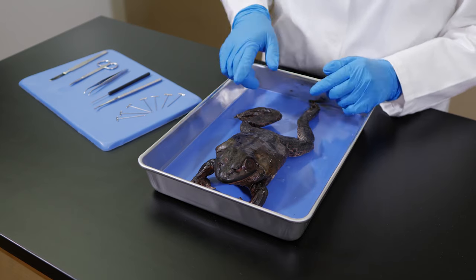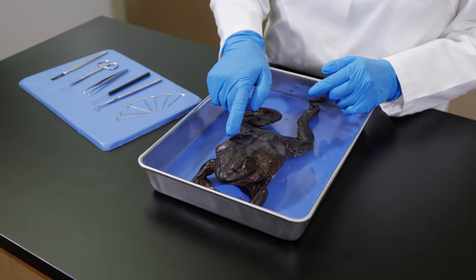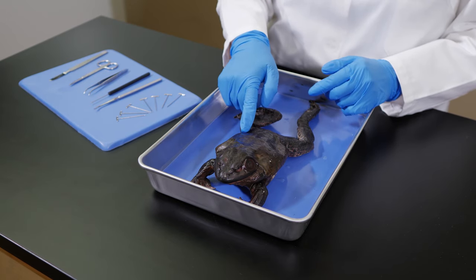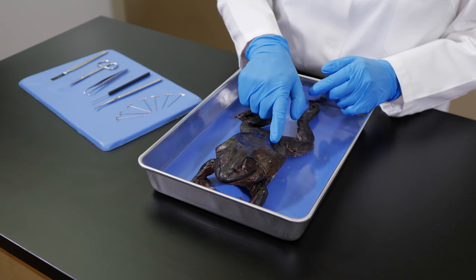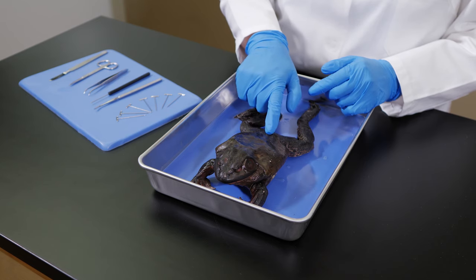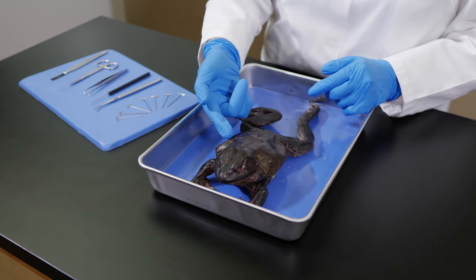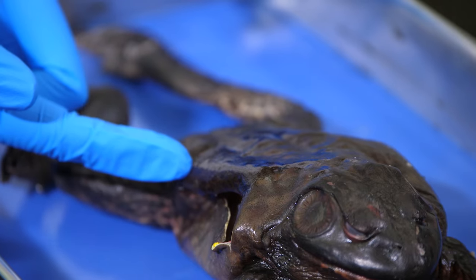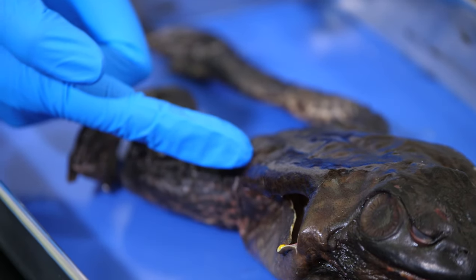Notice the skin. The frog is an amphibian, so its skin is smooth and moist, not dry and scaly like a reptile's skin, and not hairy like the skin of a mammal.